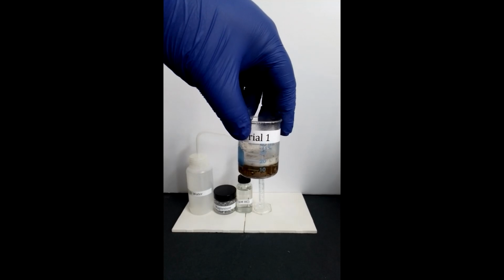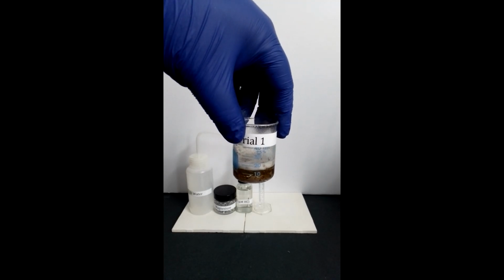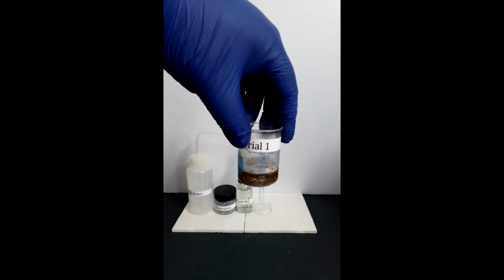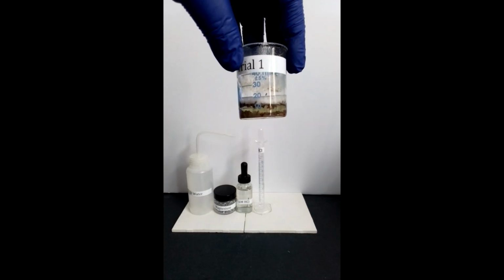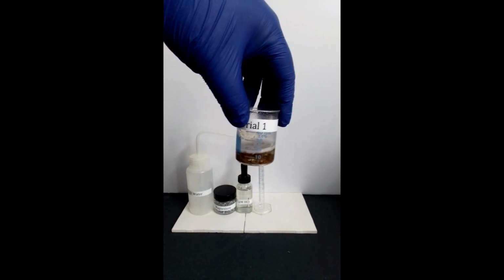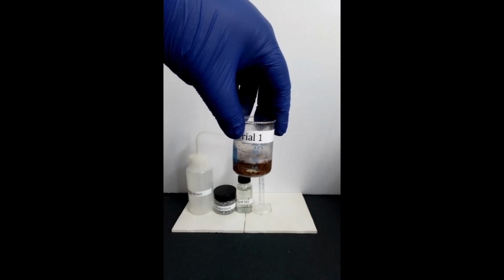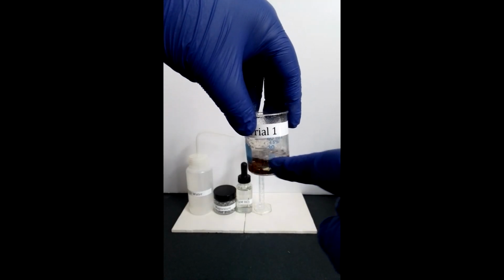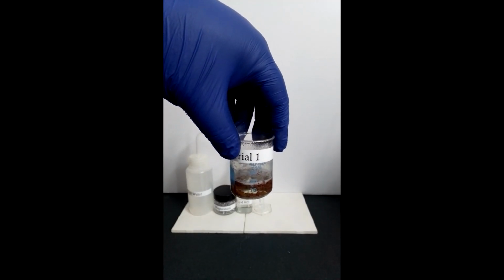Most metals, when reacted with acids such as hydrochloric acid, leads to the formation of hydrogen gas as a product. The other product formed is magnesium chloride, which is evident by the clear solution observed.